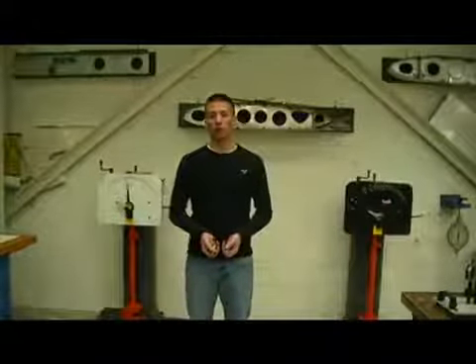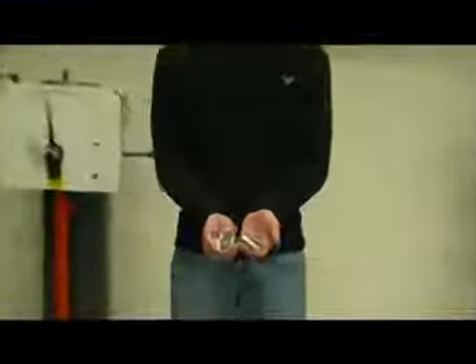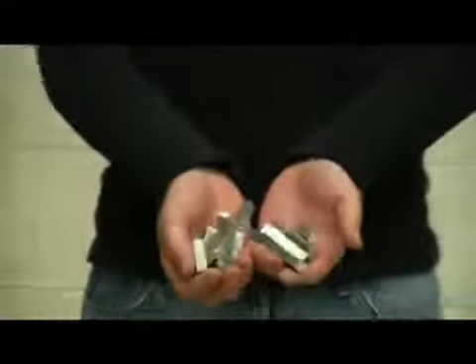With the experiments now complete, you should have run 12 full tests, 6 on the Charpy test machine and 6 on the Izod test machine. You're going to have a lot of broken samples lying on the floor, so make sure you clean them up as a courtesy to your classmates.